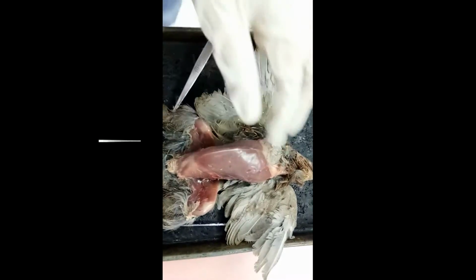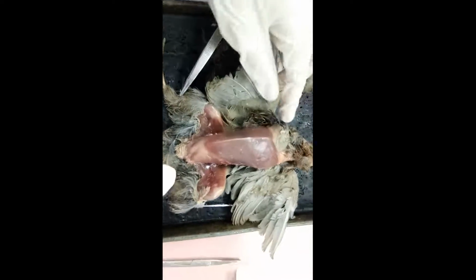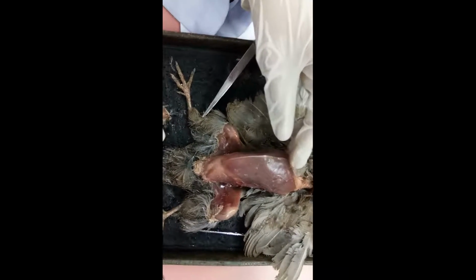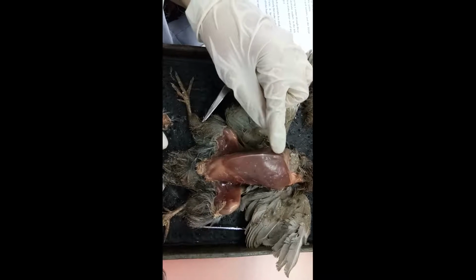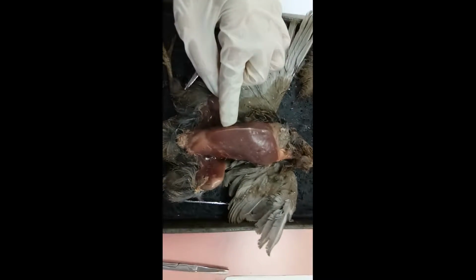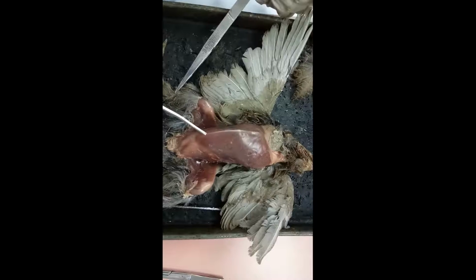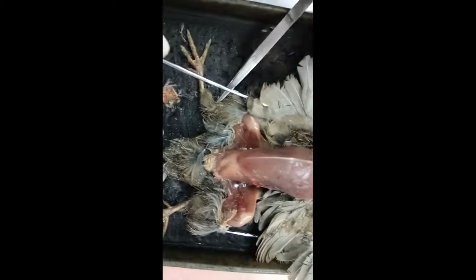After removing the skin, the muscle is now visible. As you can see, this is the pectoralis major, which covers a big portion of the body. The pectoralis muscle resides near the midline of the sternum, from which it originates. The pectoralis is inserted on the humerus and provides a powerful downstroke during flight to pull downward and forward.